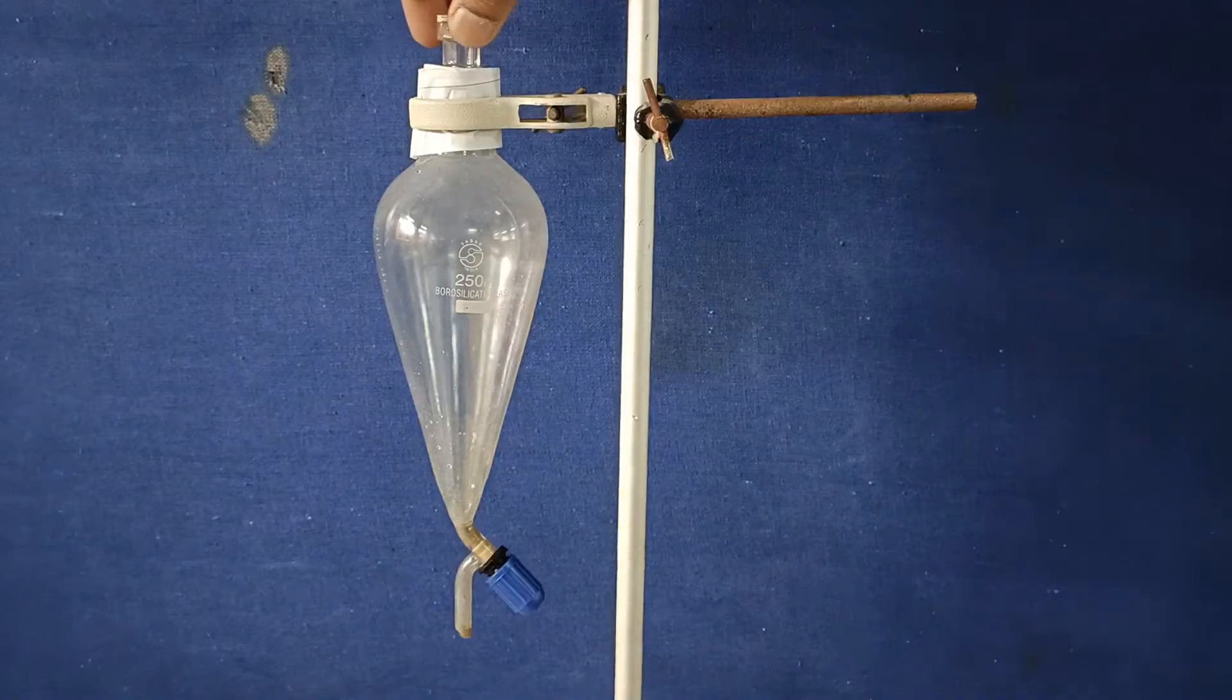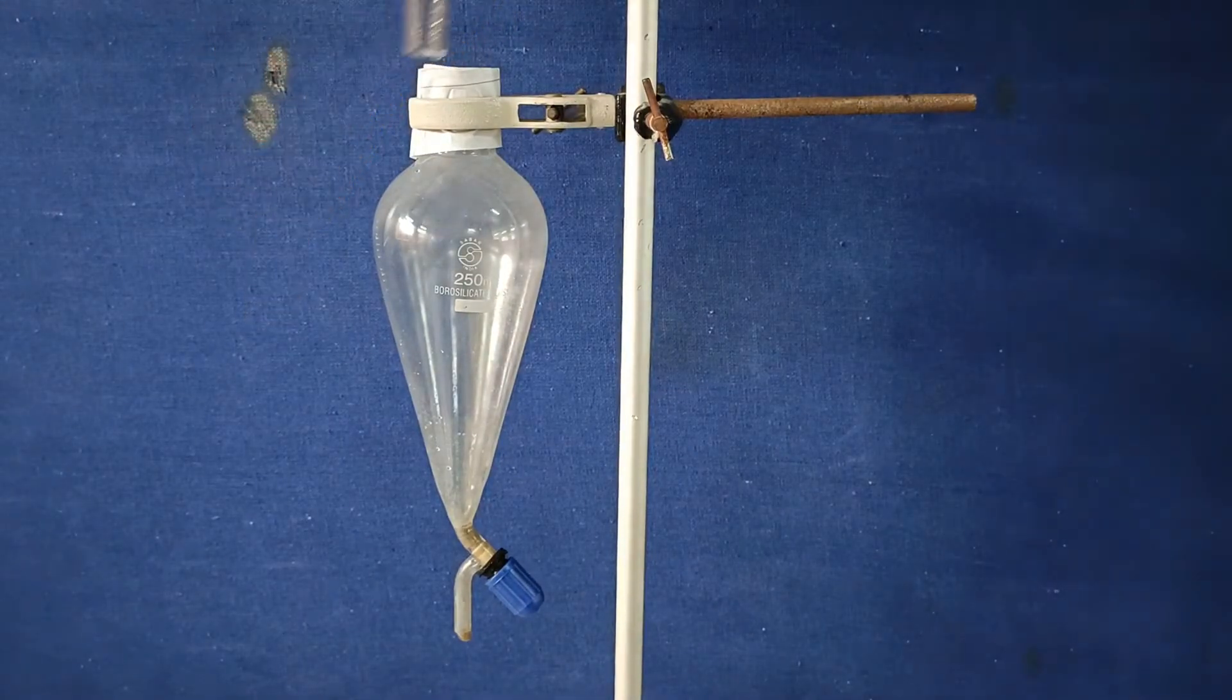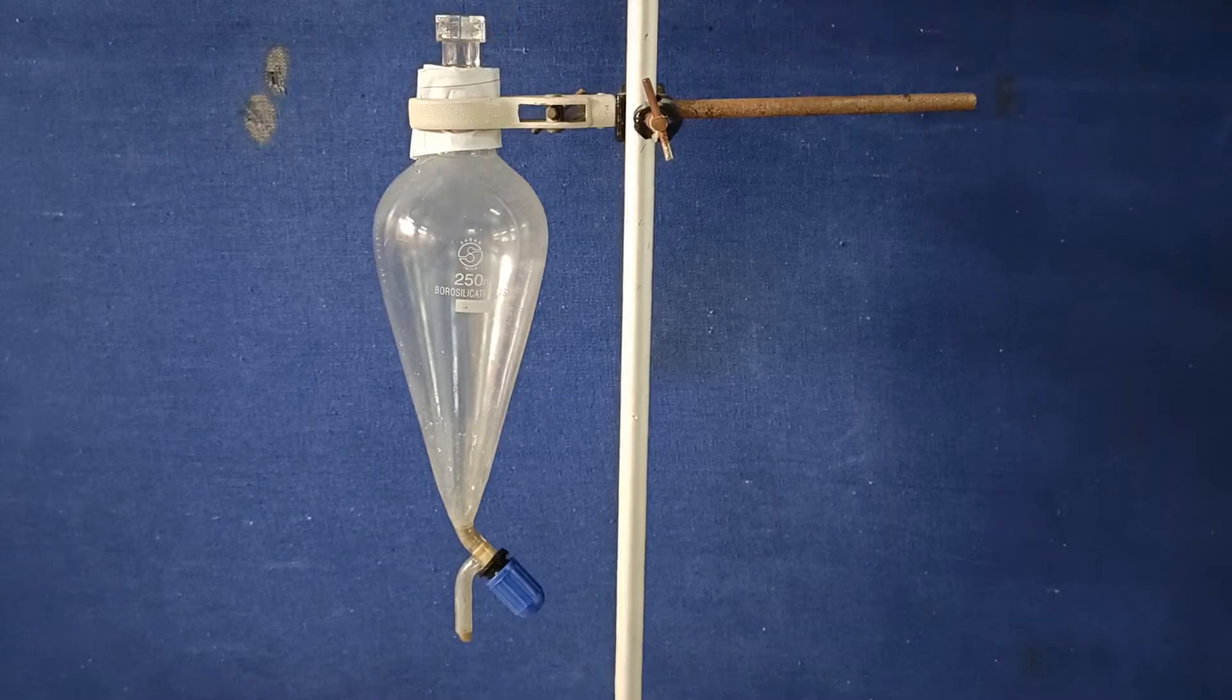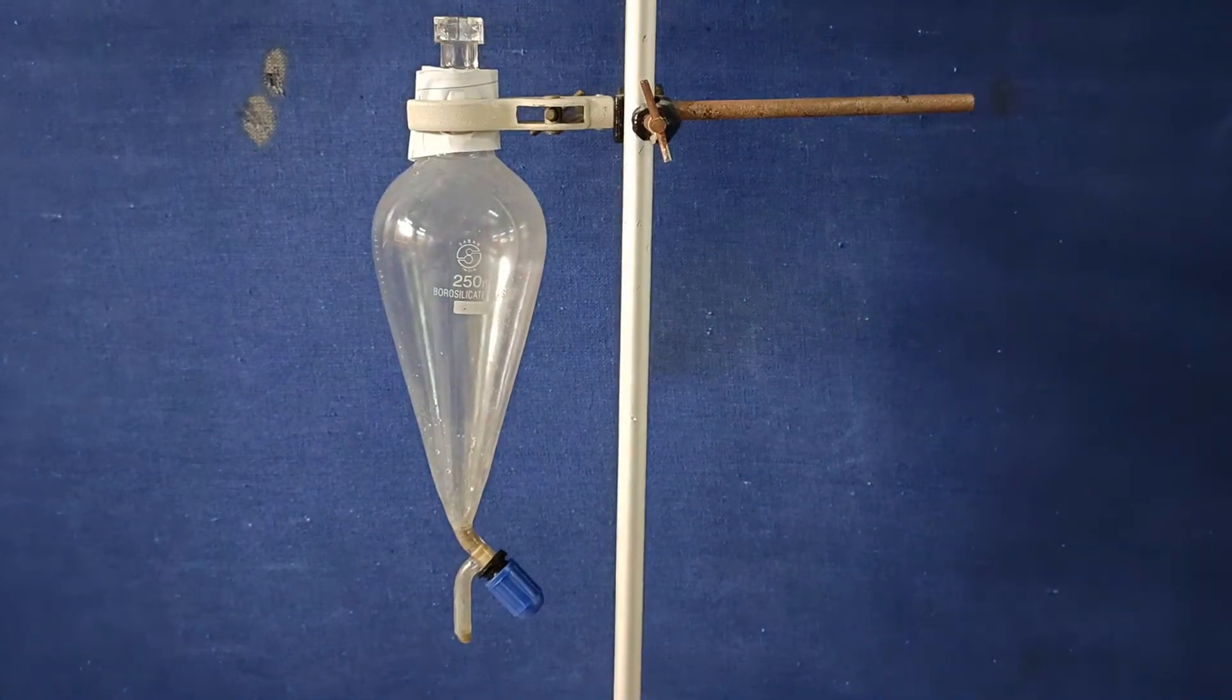This is the glass knob to close the mouth of the separating funnel. A stand is used to hold the separating funnel.